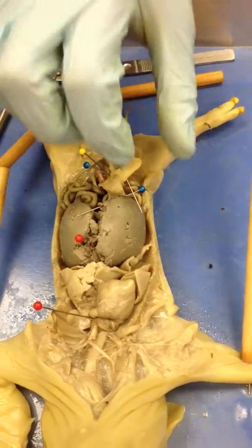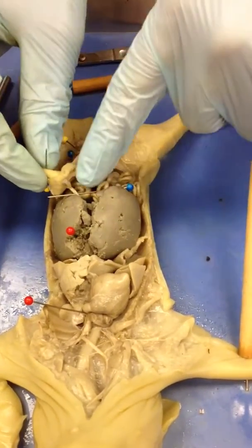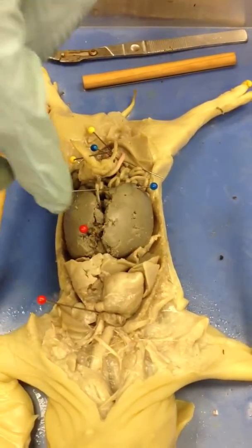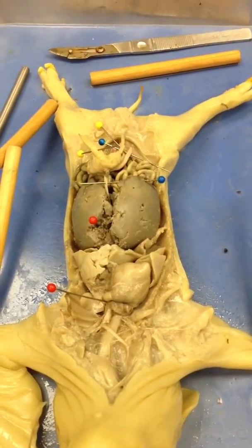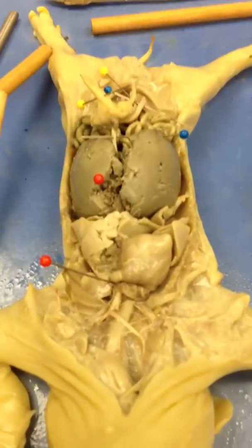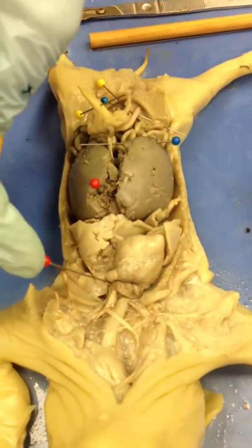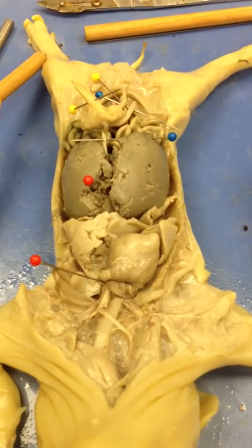That is your umbilical cord. Hopefully nobody gets that wrong. That right there, this pin, is your umbilical vein. And you can't see it, but within this liver and within that heart are two things that kind of bring all this together. So that red pin going in the liver, we're pinning basically where the ductus venosus is, and what we're pinning up here is where the ductus arteriosus is, which eventually becomes that little guy right there.